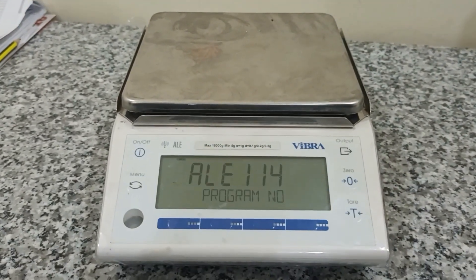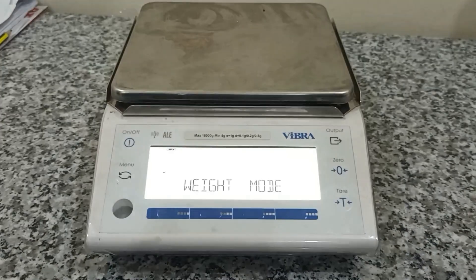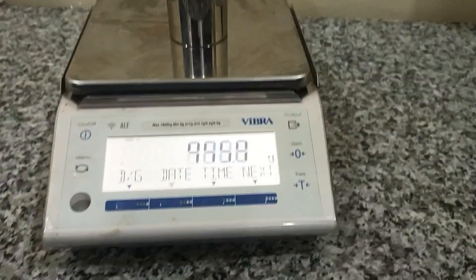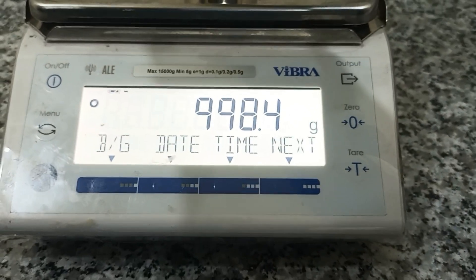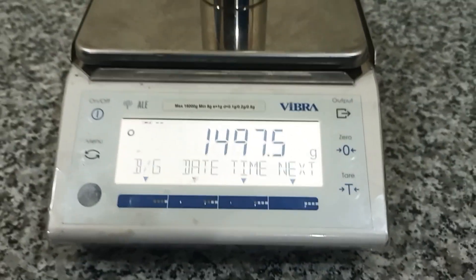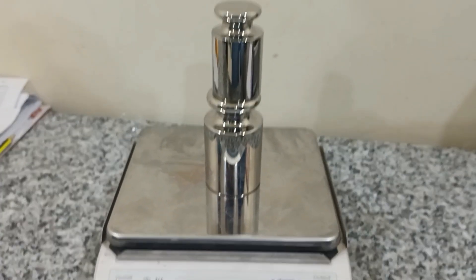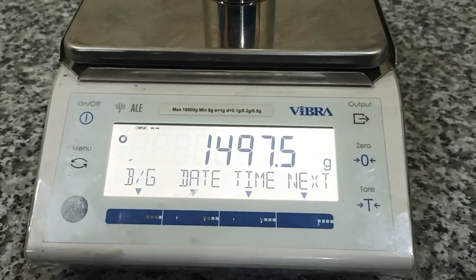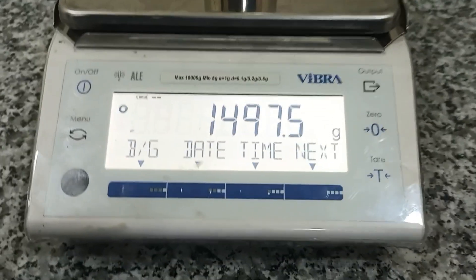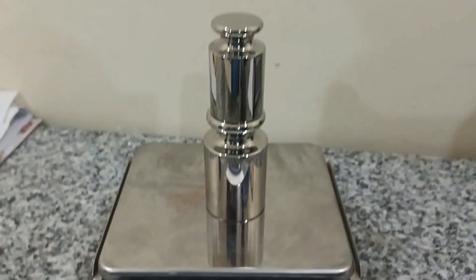I will choose stable — okay. And then I will check the standard one kg. The display does not show one kg. I add the standard 500 gram. The 500 gram is not correct either. This is the weight problem. So, how to do calibration of the balance?